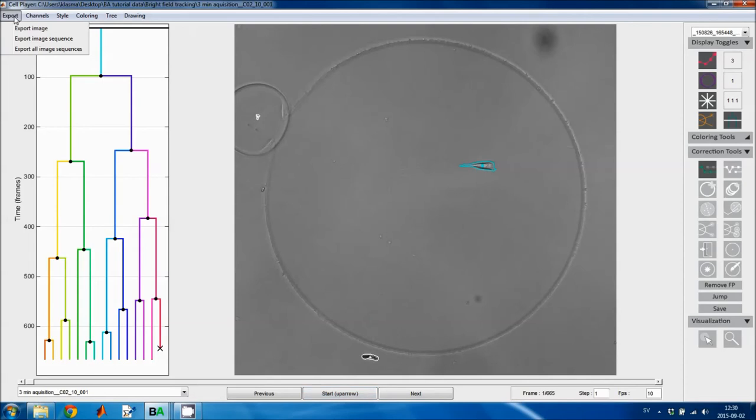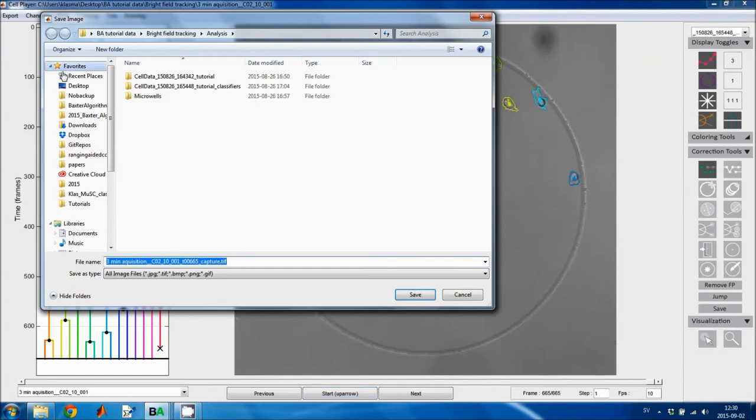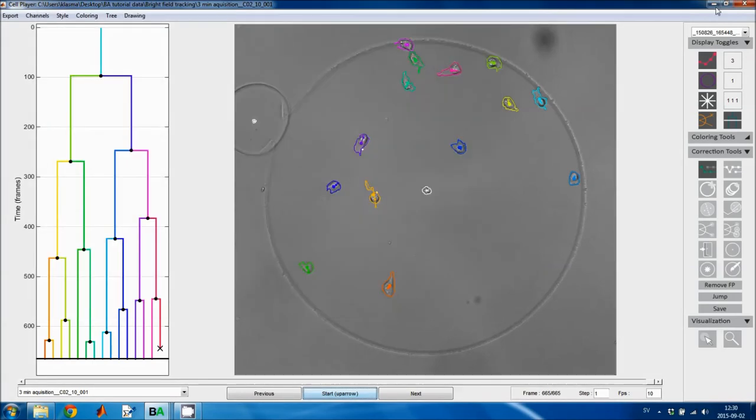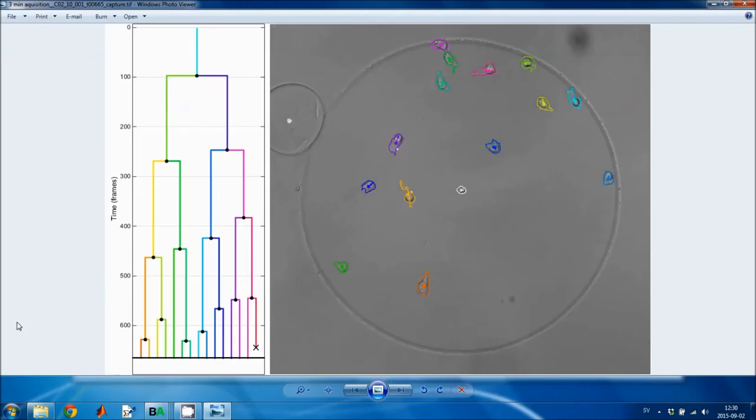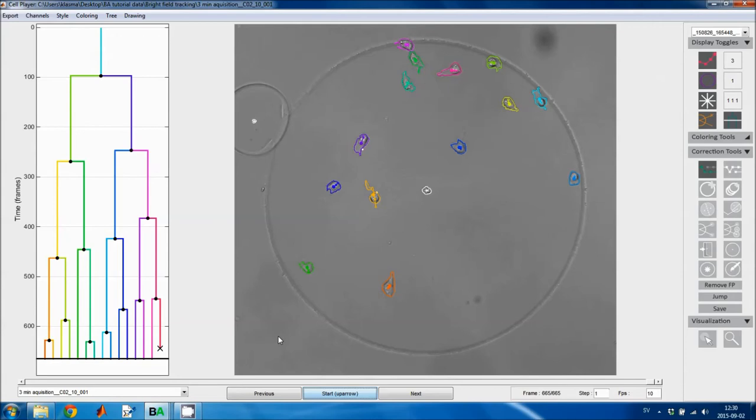The first export menu lets you export images and image sequences. If I go to the last image, I can export both the lineage tree and the tracking results. Pressing this button, I'll just save it to the desktop. Then I got this image, and I could also save sequences of images like this. And then I can select what image channels I want to show. In this case I only have one, and I can select the plotting style.